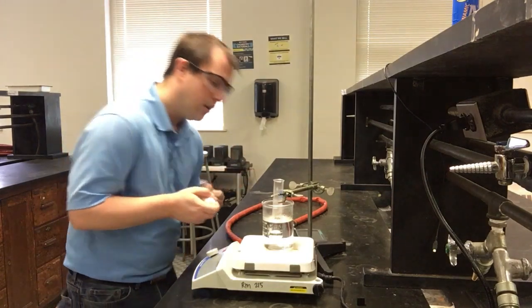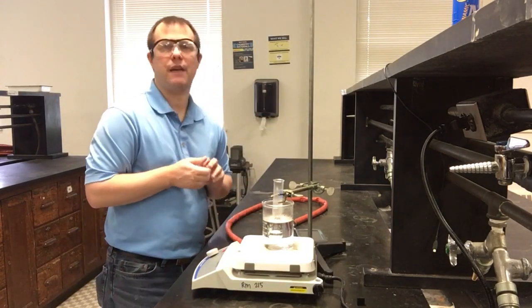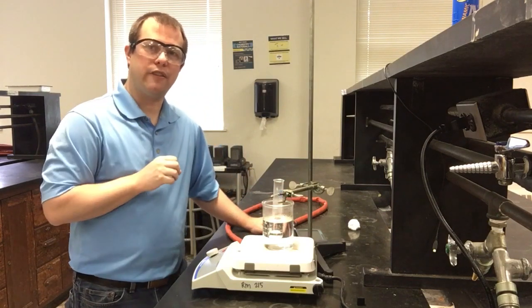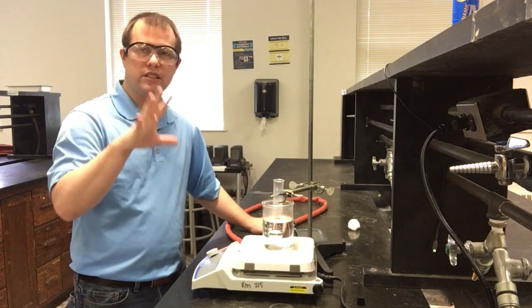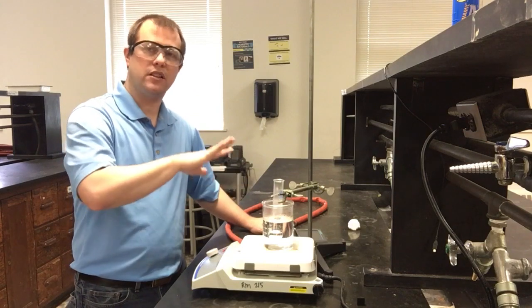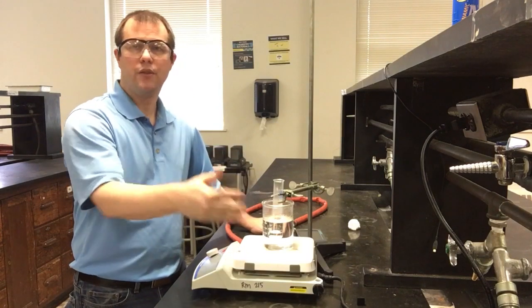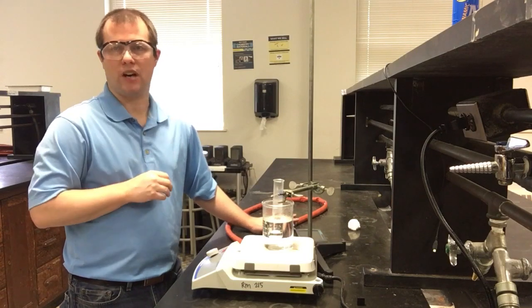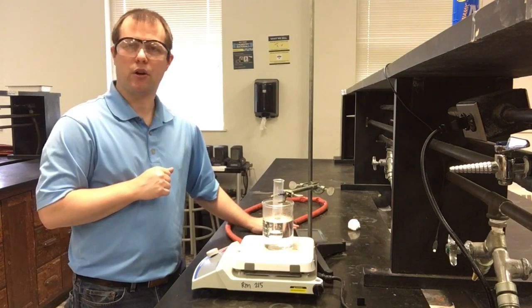But for the first part, it looks like we're getting pretty close to having all of our naphthalene melted. It's not quite all there yet. So I'm going to go ahead and pause our video here for a minute. And then when I restart things, you're going to see all the naphthalene fully melted, and a zoomed in look of the melted naphthalene, so that we can then start watching it cool down and see the general process of what we're looking for in each of the parts of this experiment.